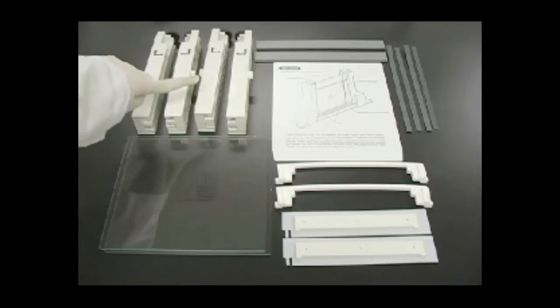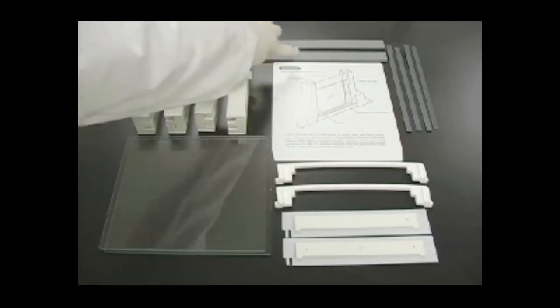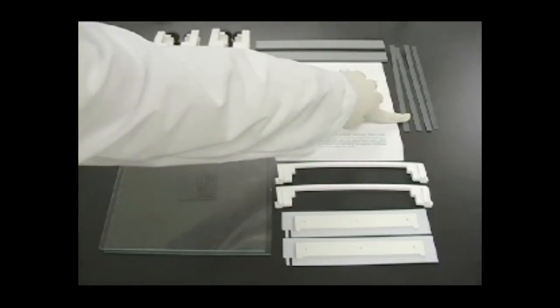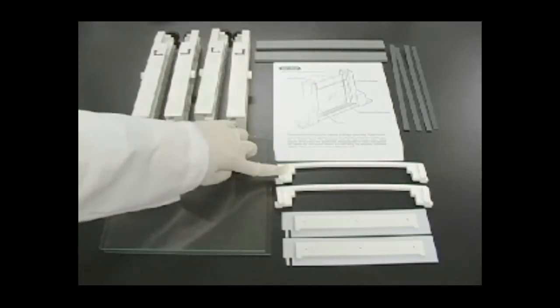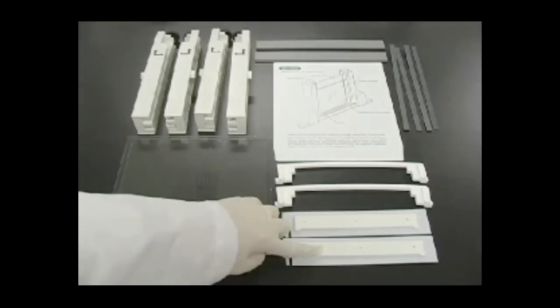20 cm notched clamps, which includes both left and right clamps, foam gaskets for the casting stand, alignment card, narrow spacers, wide sealing gaskets for the upper buffer chamber, 20 by 20 cm glass plates, and IPG combs.